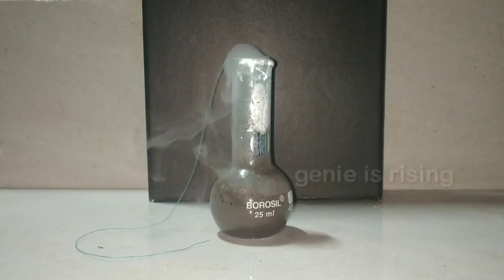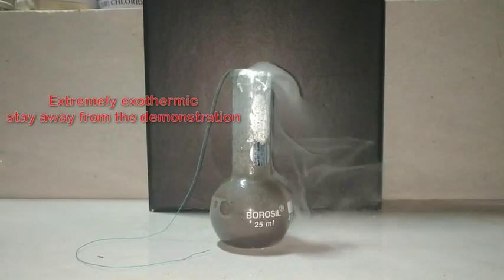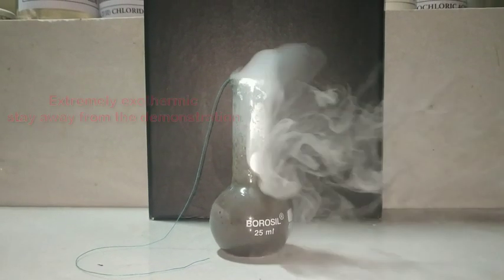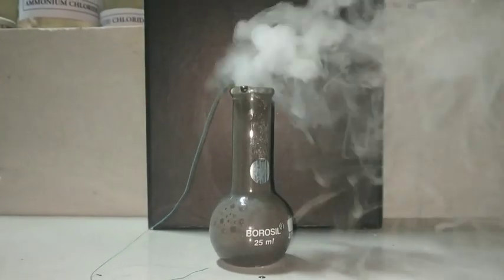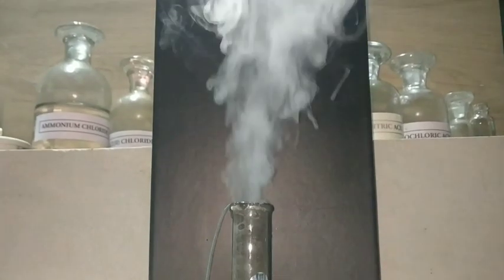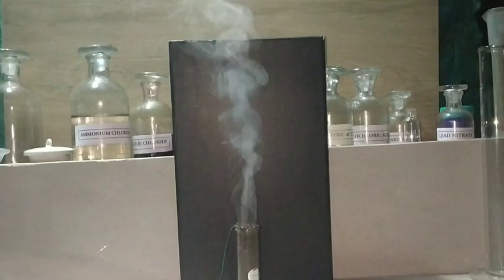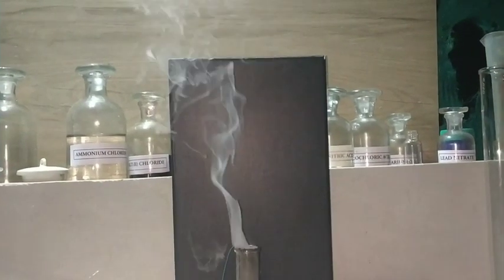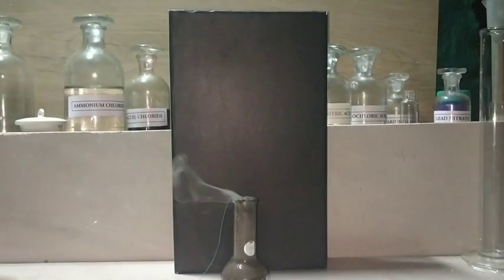You can see that manganese dioxide is reacting very vigorously with hydrogen peroxide. This reaction is highly exothermic and a lot of fumes are being produced. Here also we see the catalytic oxidation of hydrogen peroxide releasing oxygen gas and a lot of fumes. Since a lot of fumes are rising from the bottle, this experiment is classically known as the genie in a bottle experiment, where the genie rises out when we open the lid of the container.